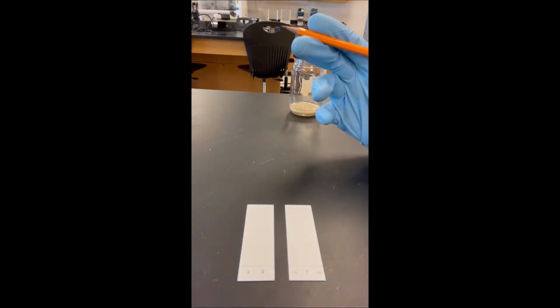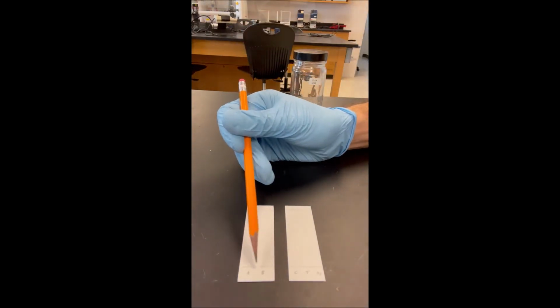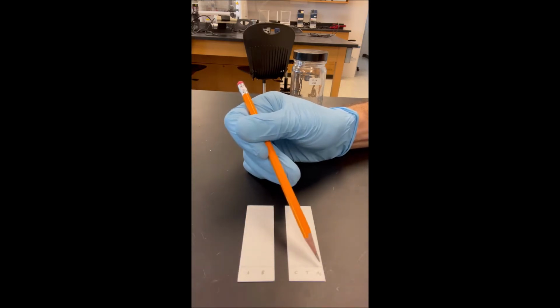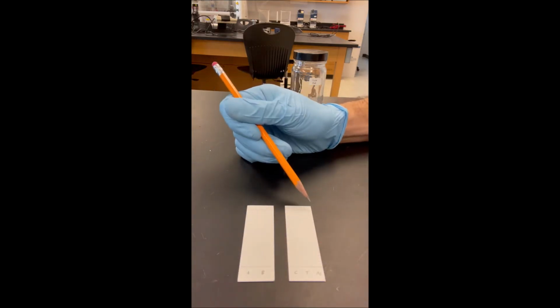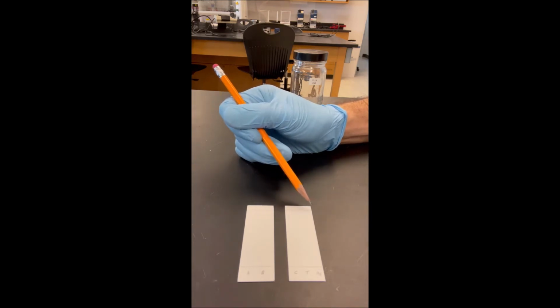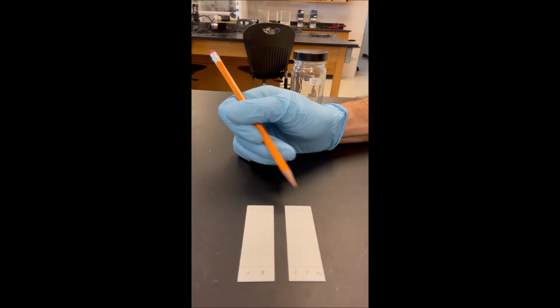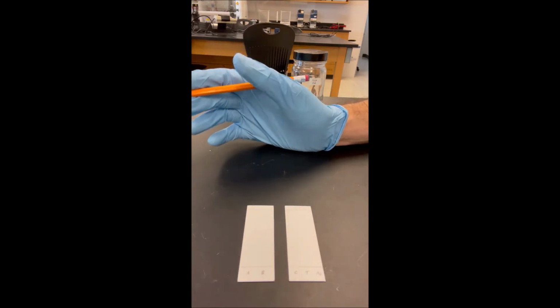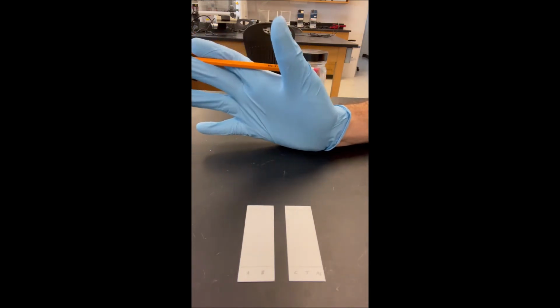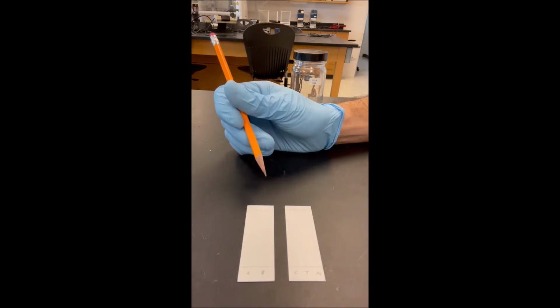So the way I prepared these TLC plates is by drawing a straight pencil line close to 1 centimeter from the bottom, and then repeated exactly the same thing on the next plate. And then another line about 0.5 centimeter from the top, more or less. It doesn't matter exactly what the distance is, but provided you can get it about the same for each plate, because you're going to be comparing these side by side under the UV lamp, so you want them to look as similar as possible. This is what your two TLC plates will look like.